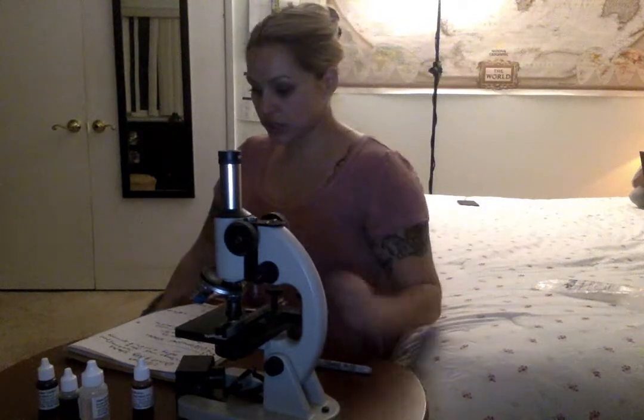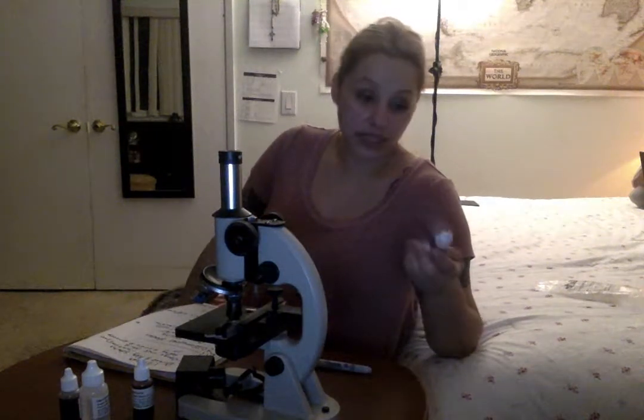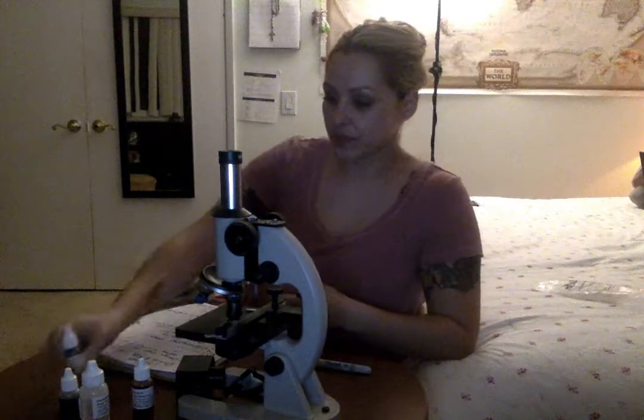The difference between the two is that the direct stain, the crystal violet, like its name, stains in a violet or dark blue shade. It grabs onto any cells or little structures or microorganisms that are on the slide. After you rinse them, when you view your slide, you can pretty much see every single little thing. So that's the crystal violet.